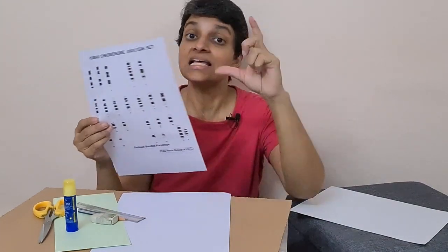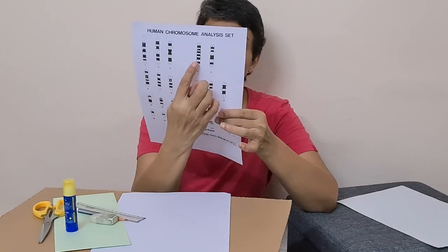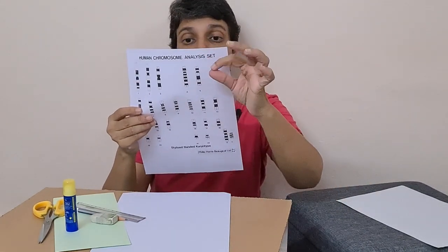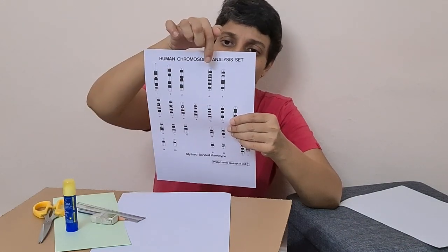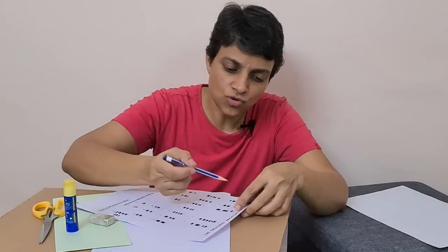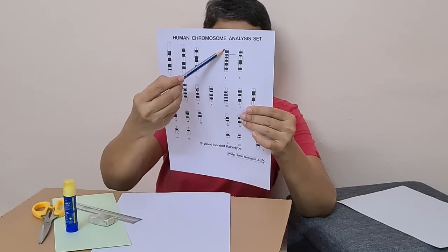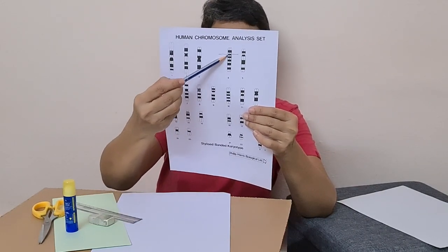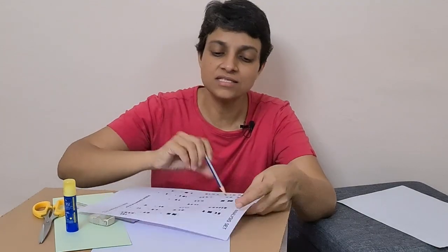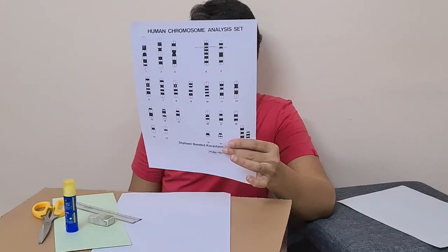Group B has large submetacentric chromosomes — chromosome numbers 4 and 5 — giving us two pairs. They are large submetacentric; the constriction is positioned such that the P arm is much shorter compared to the Q arm. The P arm is very small and the Q arm is very long, making it submetacentric.